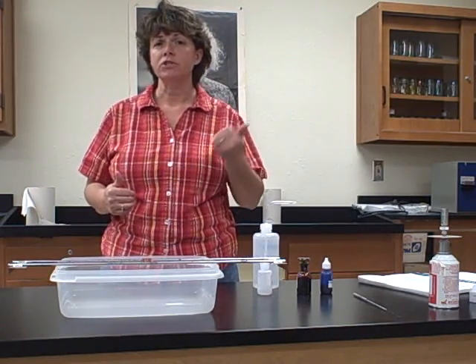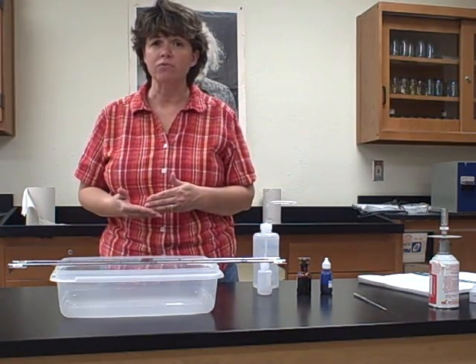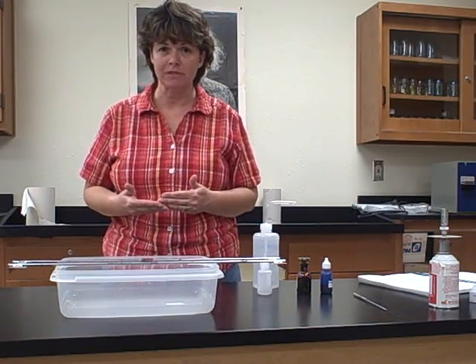If you refer back to the Gram stain, which was a different type of differential stain, which differentiated between gram-positive and gram-negative bacteria, our decolorizing agent was either acetone alcohol or just regular alcohol. In our acid-fast stain that we're doing today, we are going to decolorize with acid alcohol. Okay, so that's going to be one of the differences.